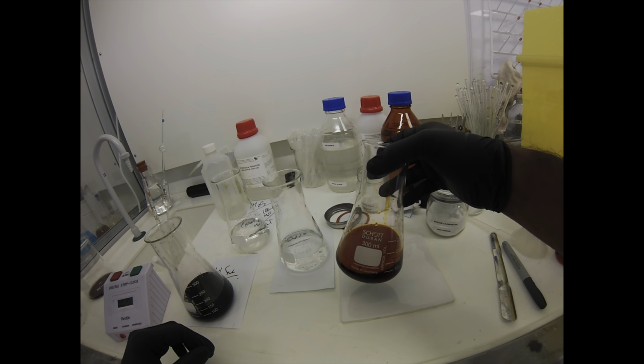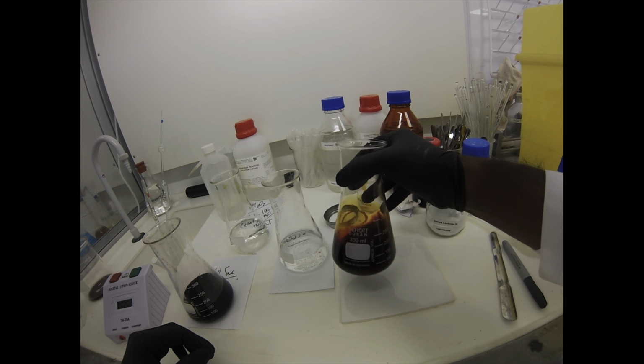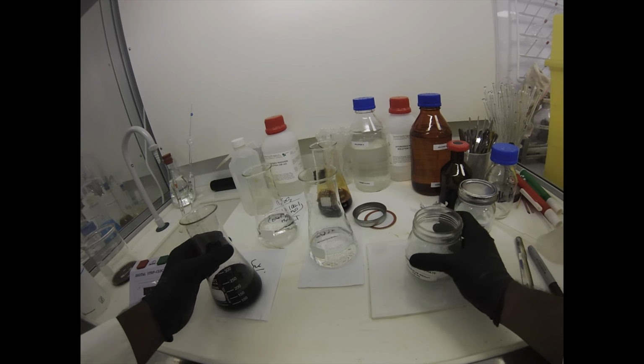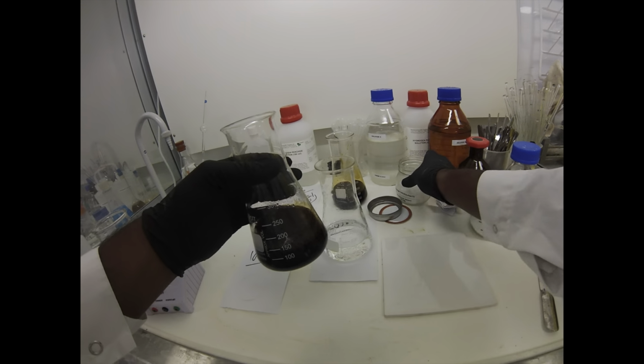So I'm not quite sure what that is. Maybe it's a site of nucleation for the peroxide. If anyone knows, do let me know. But yeah, you'll get this fizzing coming on the addition of thiosulfate with the older stuff. So it's better to just get rid of it straight away.